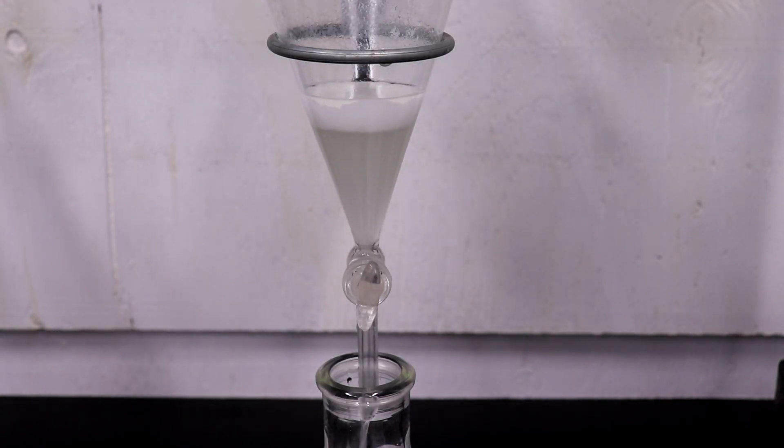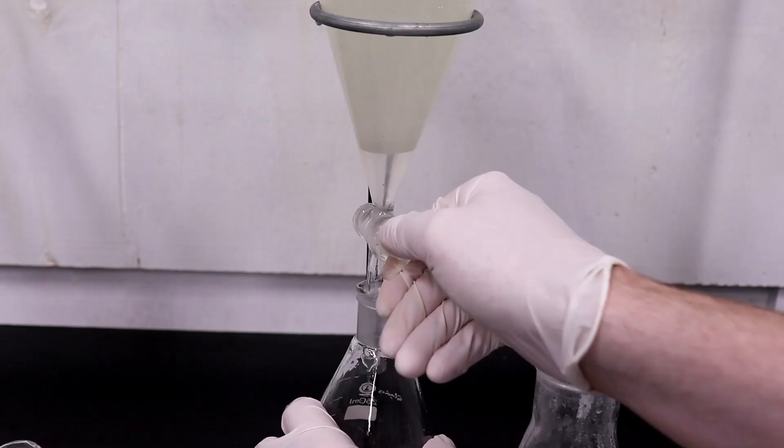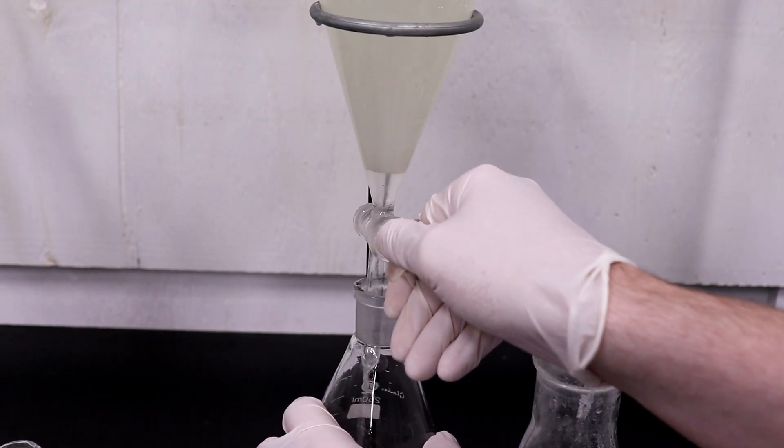However, I ran out of ether, so I had to finish the final 3 washings with chloroform, and I transferred those washings into a separate flask.